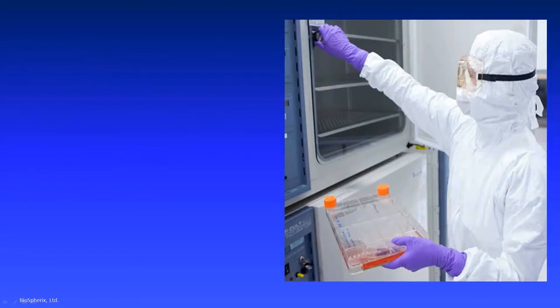A lot of people think of this. They think of a traditional room air CO2 incubator. But I'm going to make the case that actually this is a terrible place for cells and tissues. For one, from the cell's point of view, the oxygen inside is far too high for cells that come from inside the body. And the CO2 and temperature are fine as long as the door stays shut. But every time that door is opened, whether it's you accessing your cells or someone else in the lab accessing theirs, all the conditions change. So this is a highly variable environment from the cell's point of view.